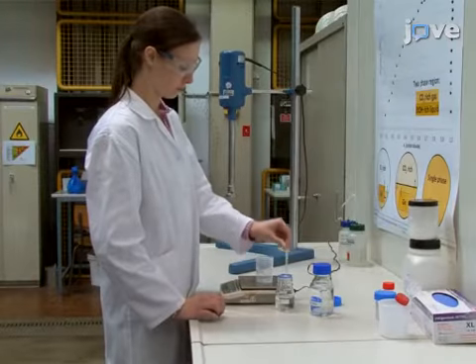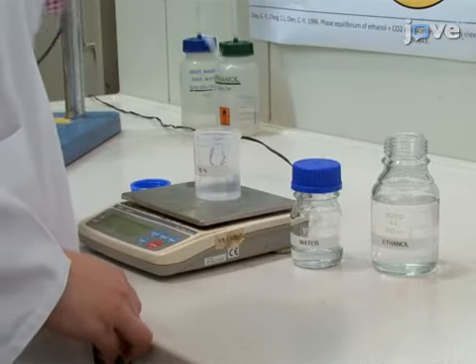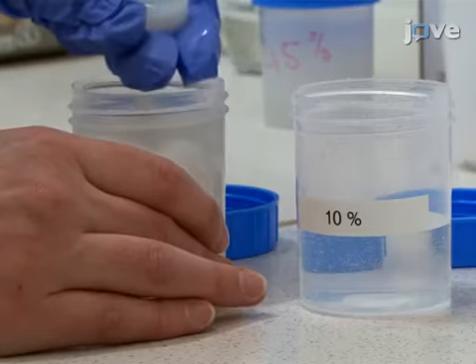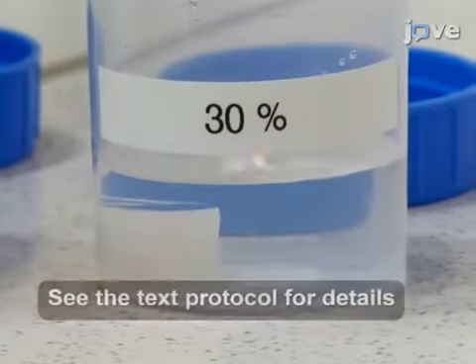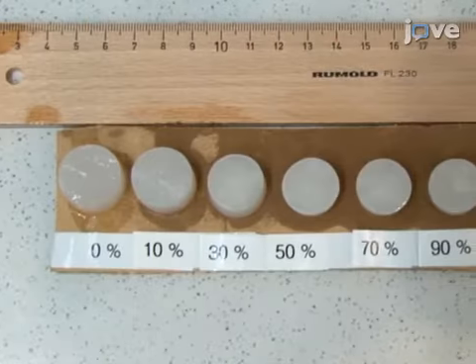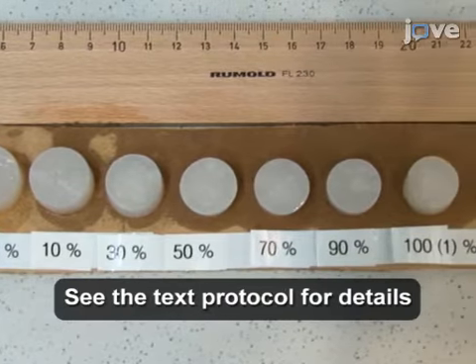For each gram of prepared hydrogel, make 10 grams of ethanol and water at a 1:9 weight ratio. Then, immerse the hydrogels in the ethanol and water mixture for 12 hours. The equilibration time is mainly dependent on the sample thickness. Later, immerse the gels in a 3:7 weight ratio solution of ethanol in water.